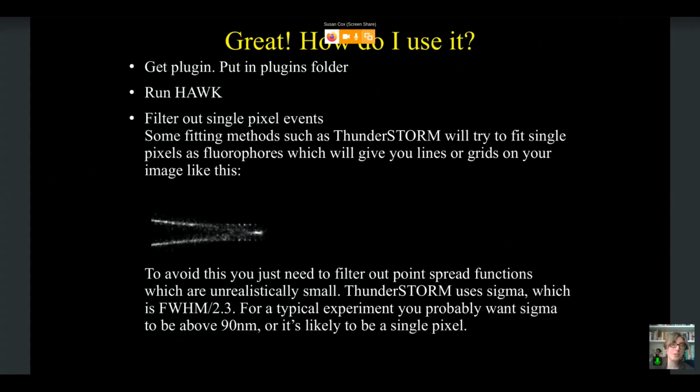The only thing that you do have to be a little bit careful of is that a lot of the fitting methods, such as ThunderSTORM, have a tendency to fit single pixel events as arising from fluorophores. So they do tend to fit single pixels, not as noise, but as fluorophore events. And that can lead to this effect that I've shown here, where you have bright spots appearing at your original camera pixel distance. And this is just because for some reason ThunderSTORM cannot distinguish between single pixel events and fluorophores.